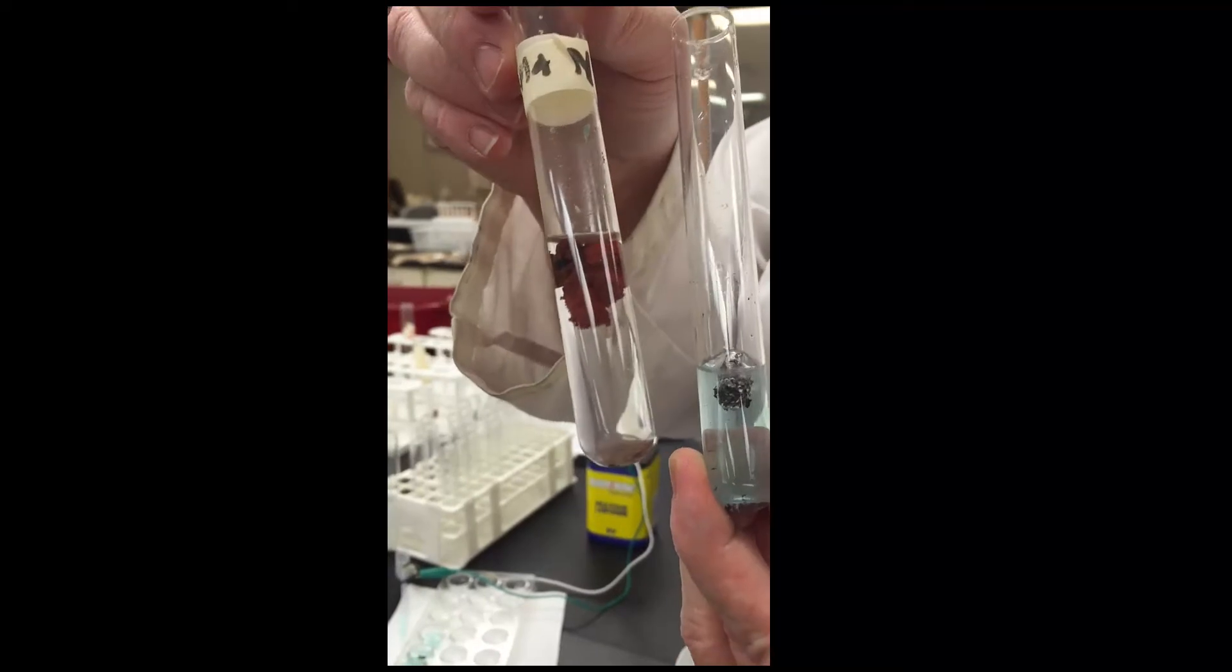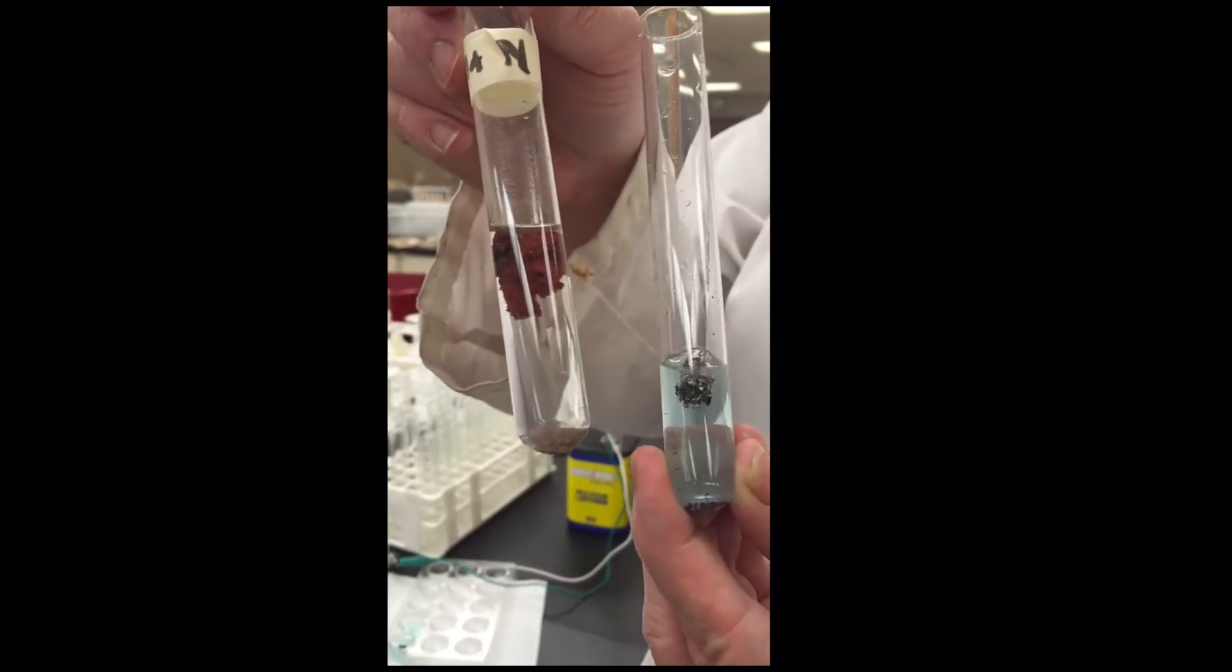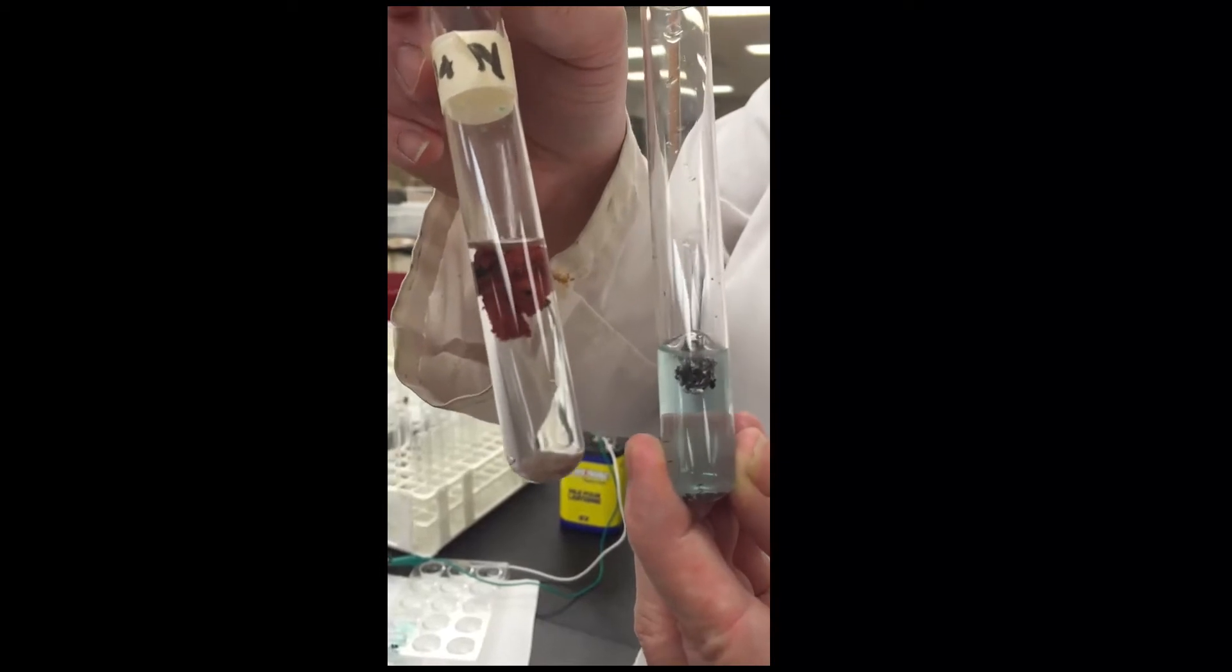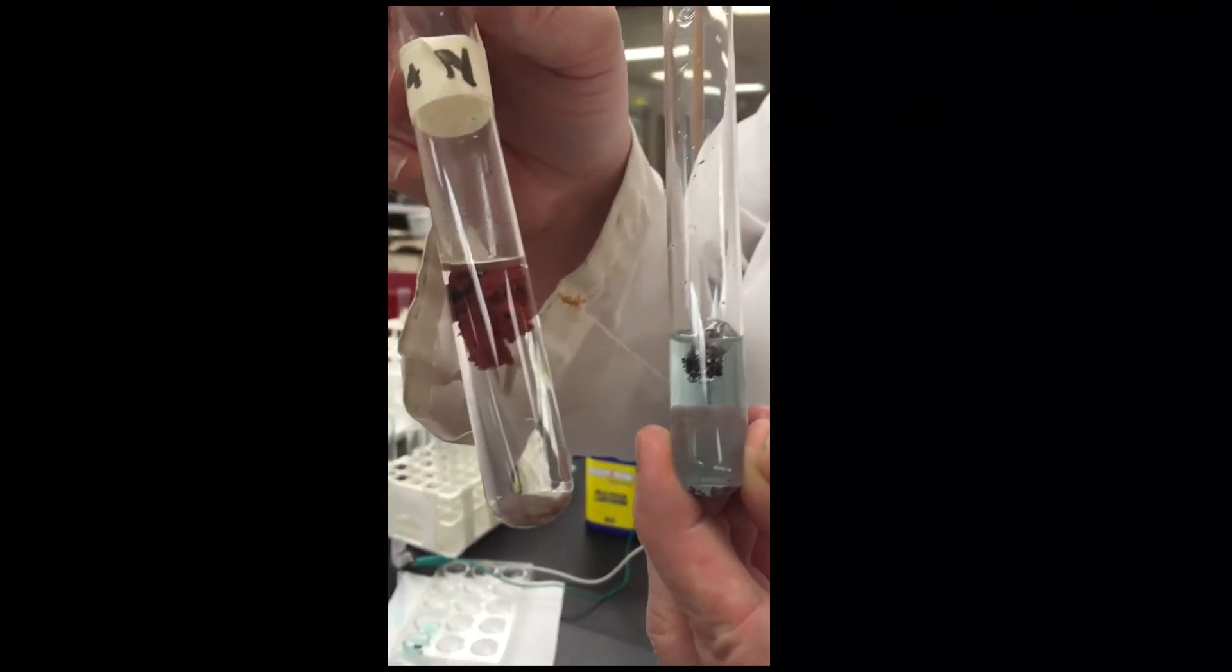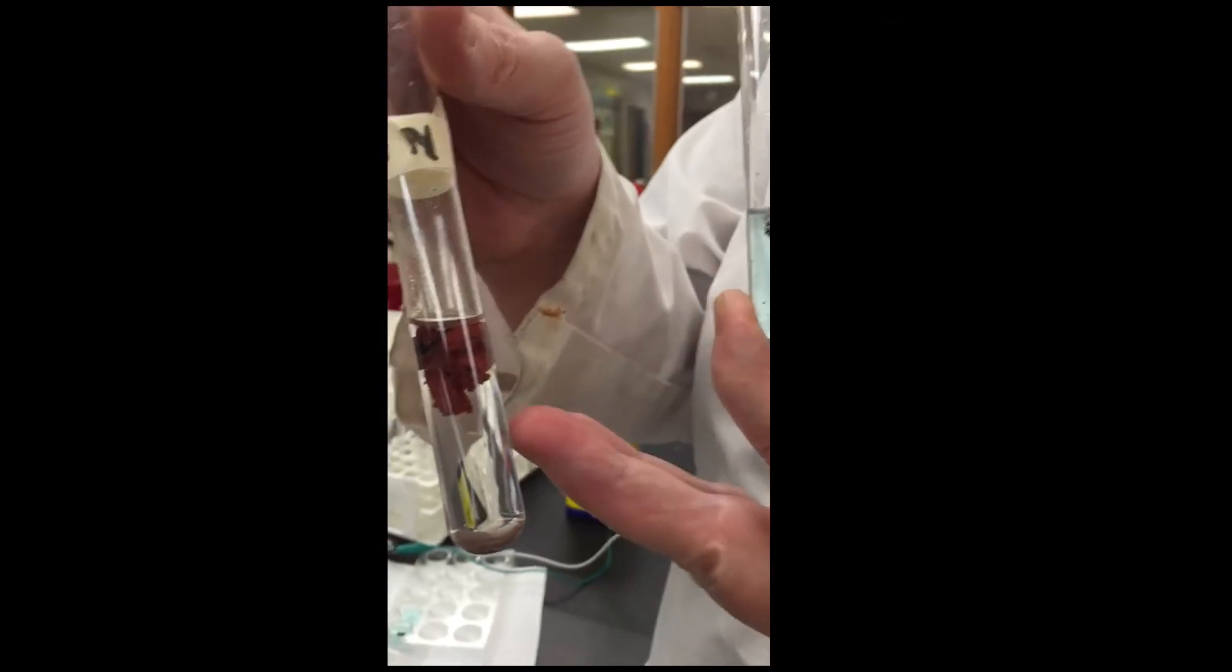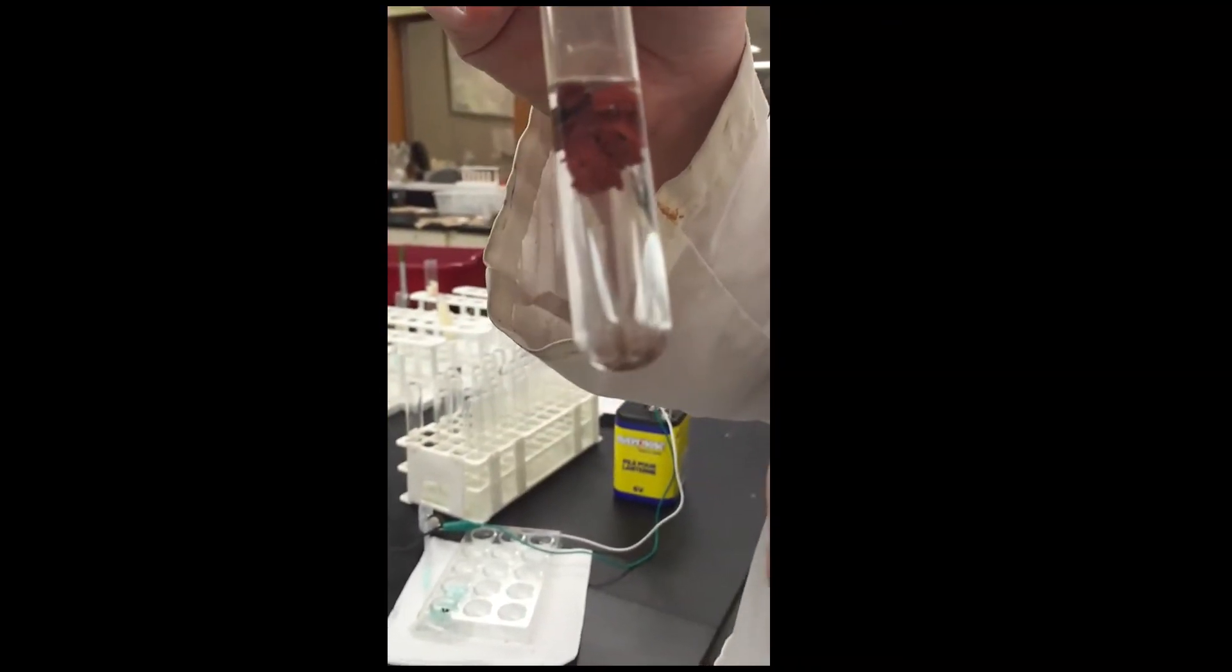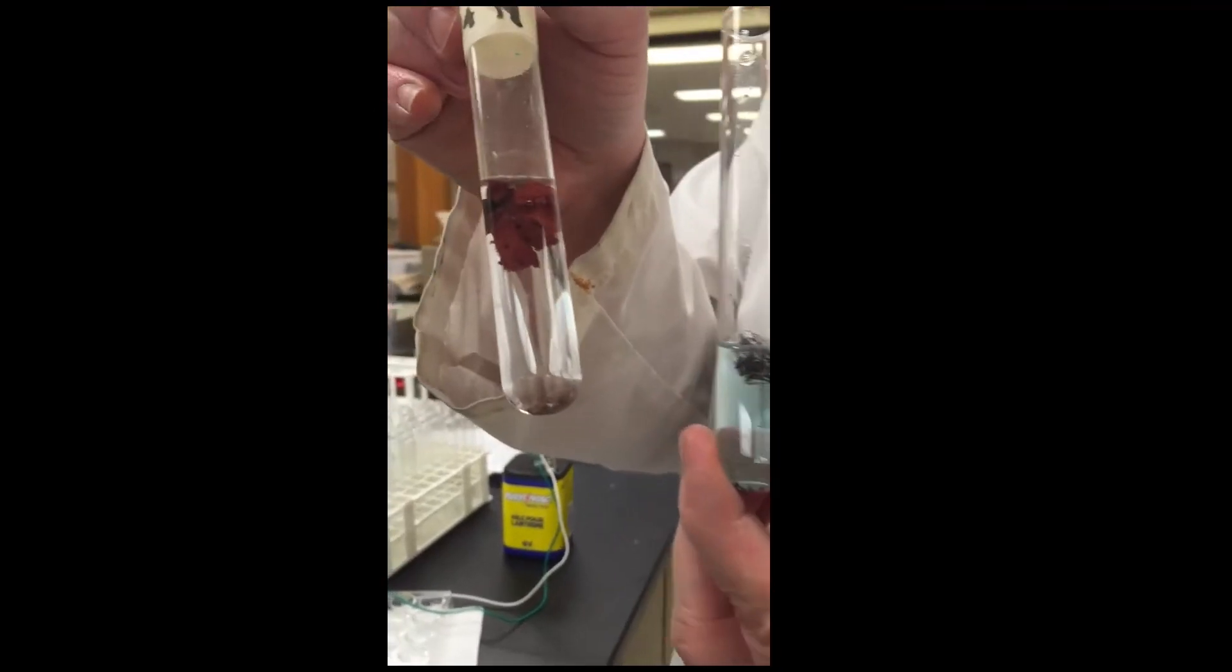This is a single replacement reaction. The aluminum is replacing the copper. Aluminum was originally by itself as the metal. At the end, copper is by itself, and in the clear solution here is the aluminum chloride dissolved in water.